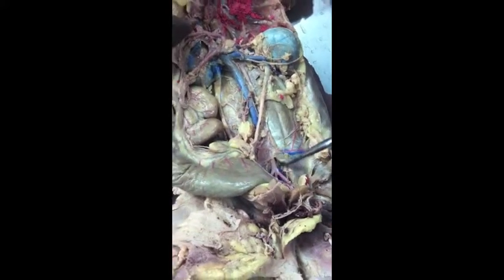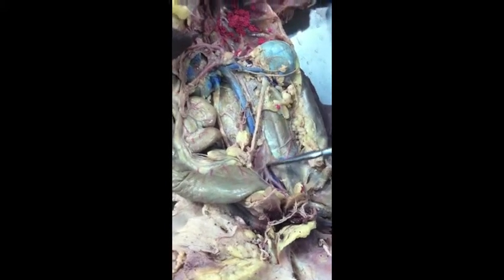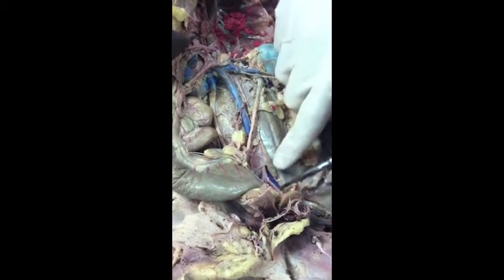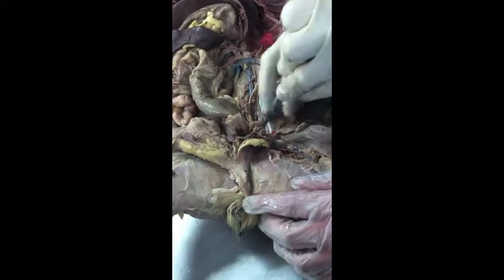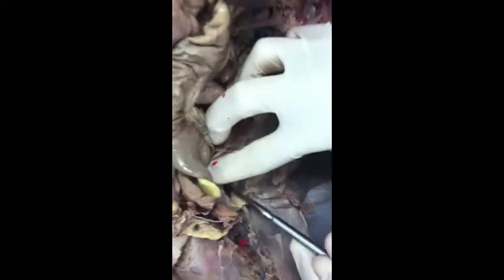How about the veins? What do they split into? Internal and external iliac, so they have the same names. Right when it branches, it's called common iliac. Then as we go a little further down, it's external iliac vein. And the internal iliac vein is underneath, deep under all of it. The shadow is not going to let you see it, I don't think. But as long as we find the external, you can tell the internal will be down here right where my probe is now, but if I keep pushing, it's going to snap it. It's way down there.